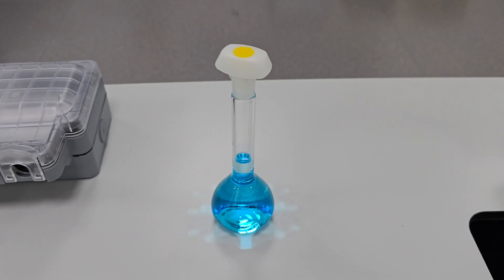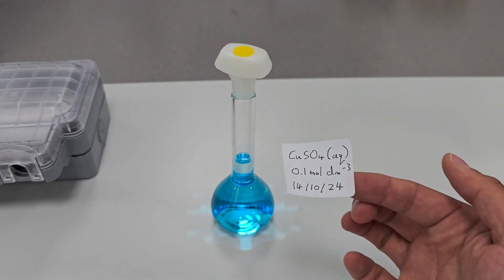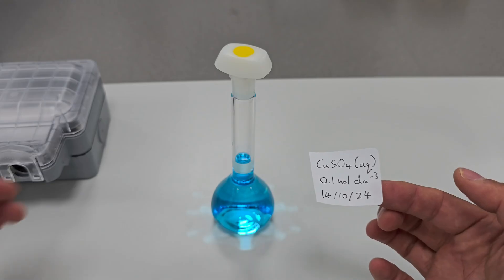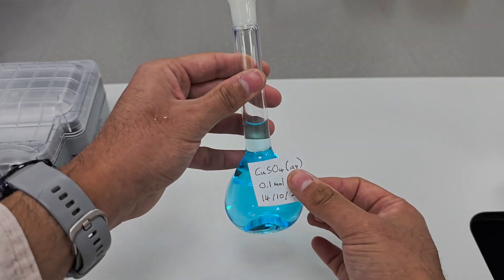Finally, I label the flask with the contents, concentration, and the date. This is important for keeping track of your standard solutions in the lab.